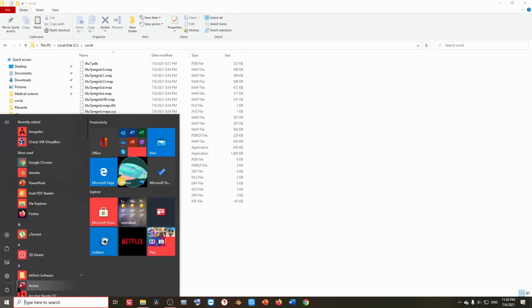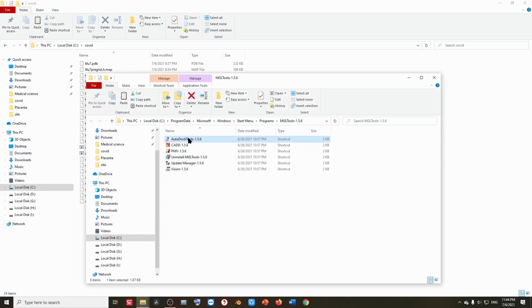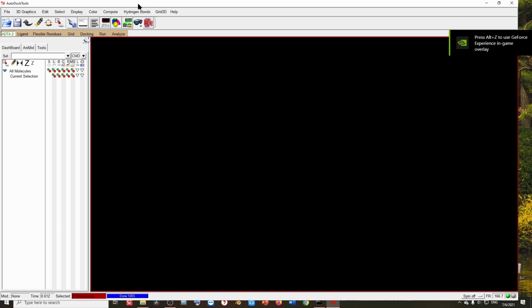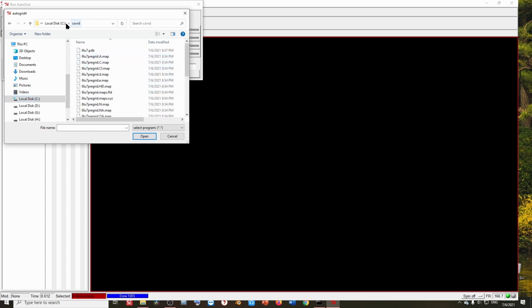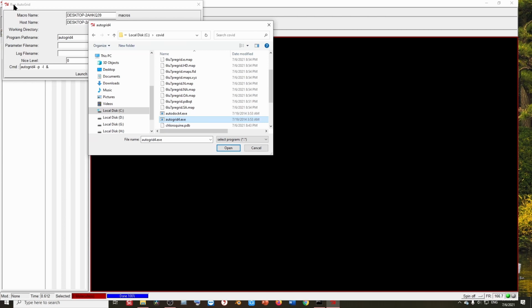Then let's move forward. Let's go to AutoDock Tools, and here I'm not going to click it to open it. I'm going to right click and open the file location, and now right click and run as administrator. So here it has been opened again. We are again here in the MGL tools, AutoDock Tools, and now let's try to run AutoGrid. Now I'm not going to go to C, Program Files. I'm just going to go to C and the folder in which we pasted the files. In my case it's C, COVID.